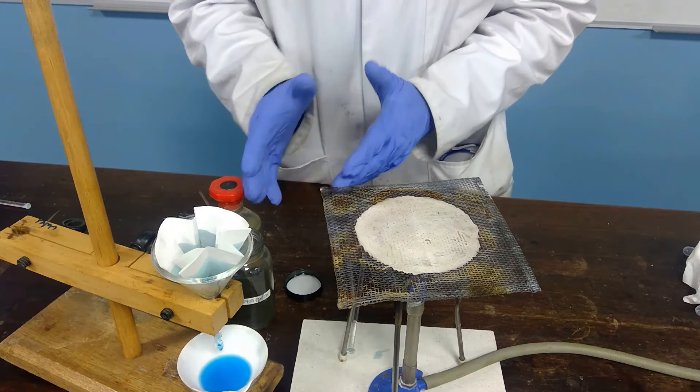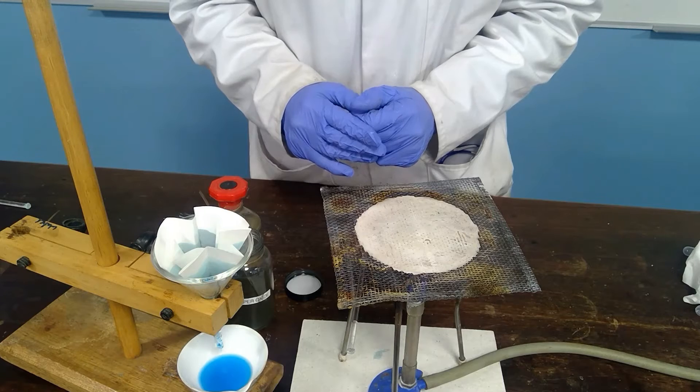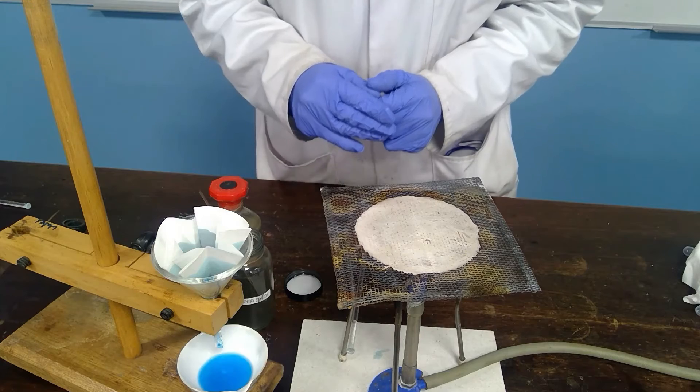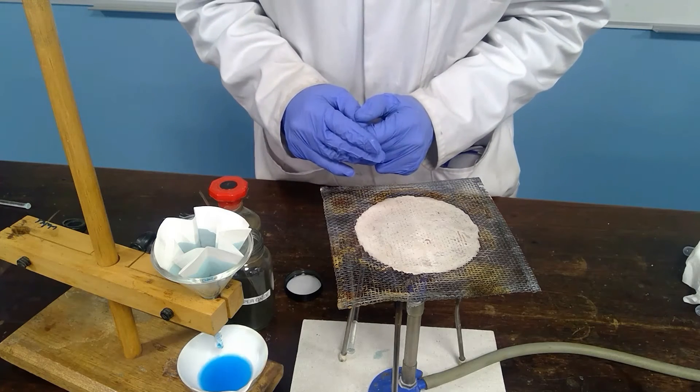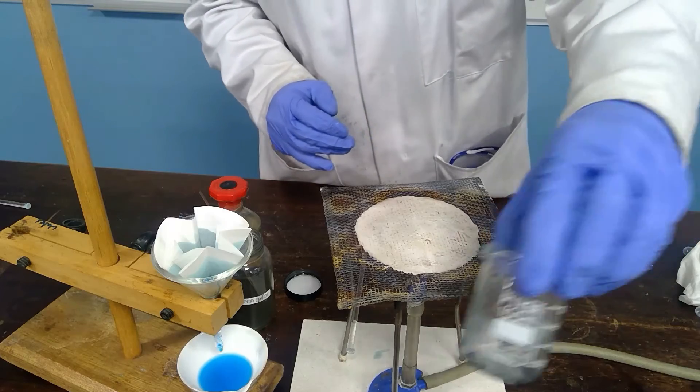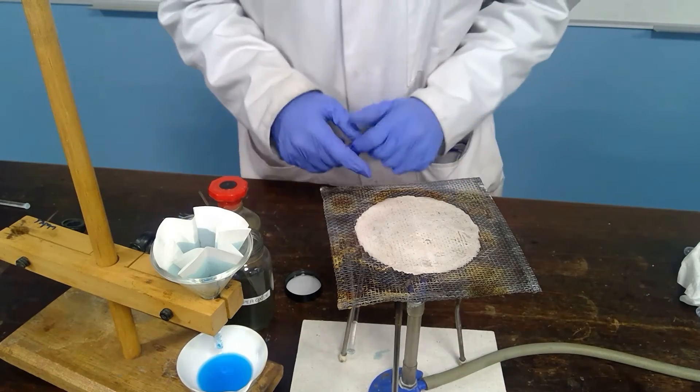So we are assuming that this solution has no sulfuric acid in it. We're also hoping it has no copper oxide and that none of the copper oxide has gone through the filtration apparatus. We're hoping that all the copper oxide is either in the beaker or has been caught by the filter paper.